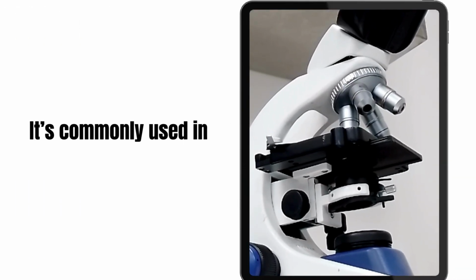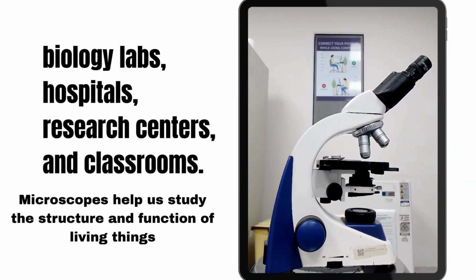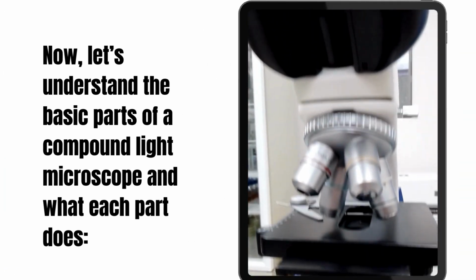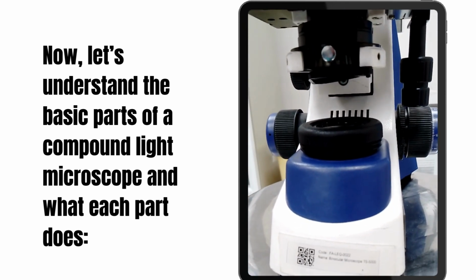It's commonly used in biology labs, hospitals, research centers, and classrooms. Microscopes help us study the structure and function of living things, especially those at the microscopic level. Now, let's understand the basic parts of a compound light microscope and what each part does.